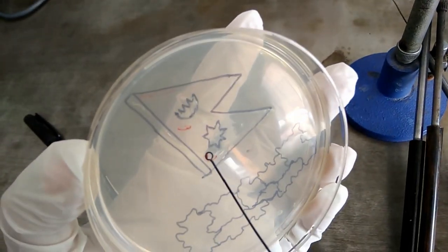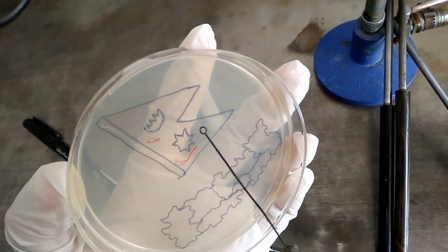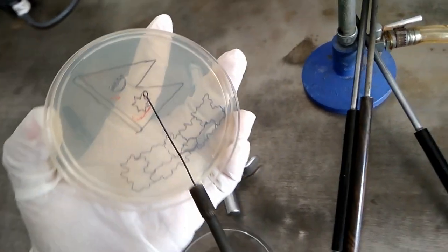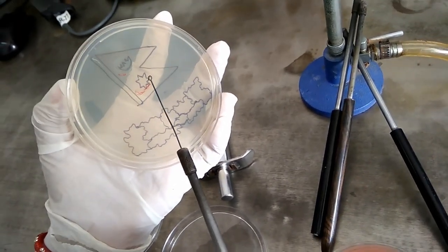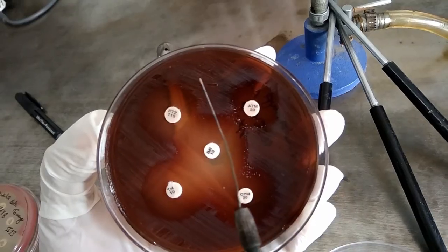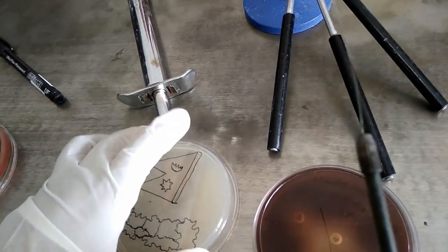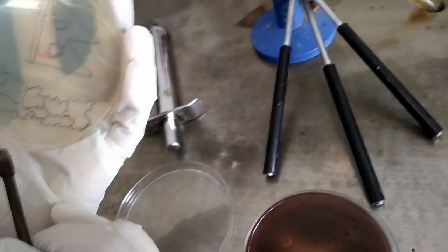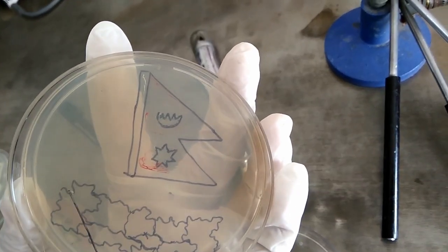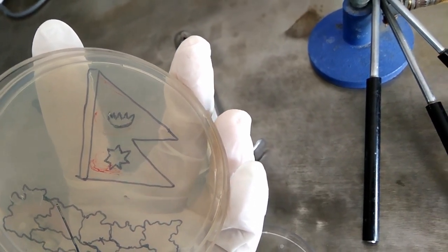A point to be noted: some organisms provide their color better at room temperature, that is 20 to 25 degrees Celsius. Therefore, further incubation at this lower temperature is required for better expression of pigments — for example, Staphylococcus aureus and Serratia.